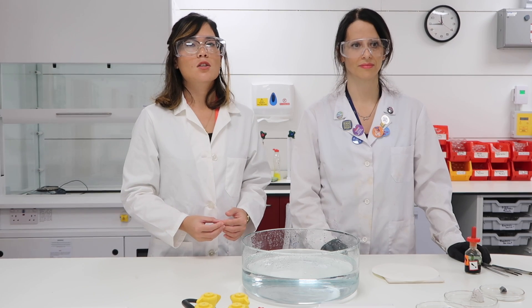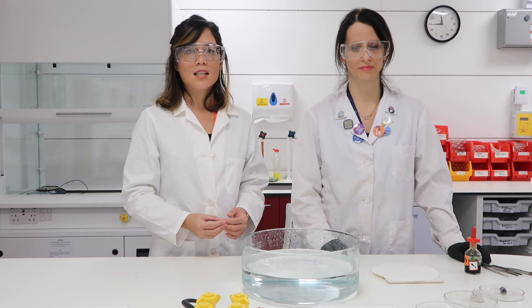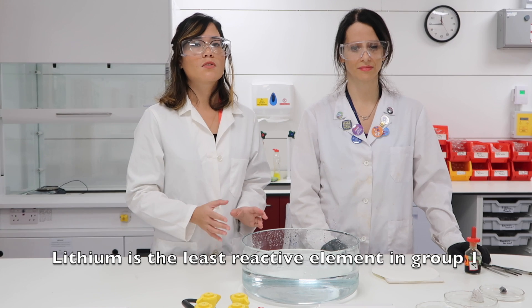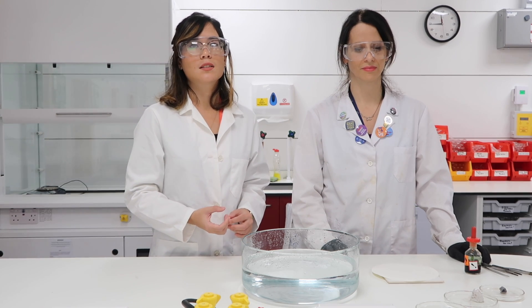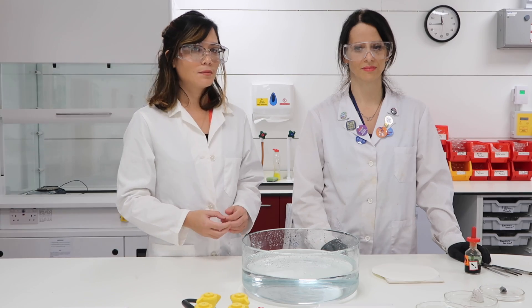Remember that lithium sits at the top of Group 1, which means it's the least reactive metal. It's really good for you to see its observations with water because you may be expected to list those in an exam.